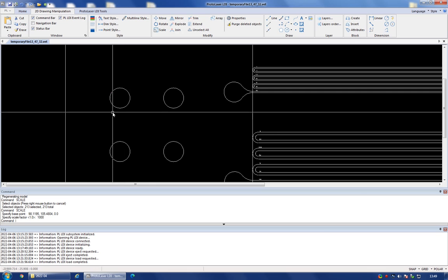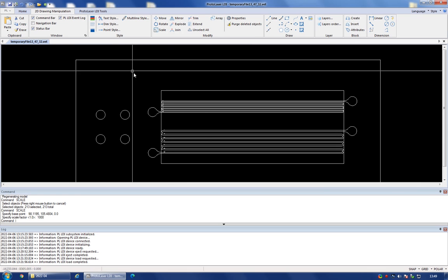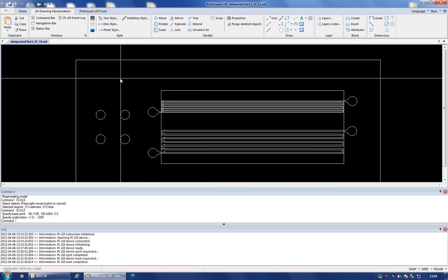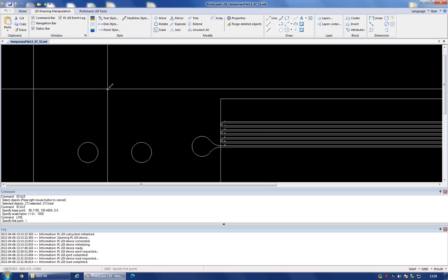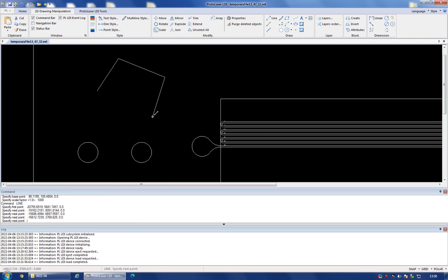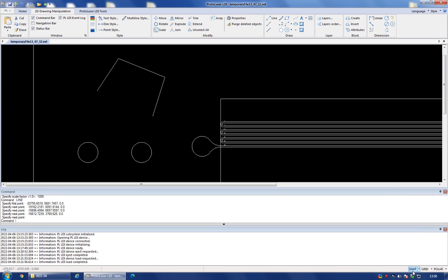So any enclosed shape really will work, but you have to be careful that it is enclosed. So for example, if I draw using the line tool, I draw just a random shape that looks like this. This is not an acceptable shape, so the software will not know what to do with a shape like this. On the other hand, we'll just turn on the snapping and the polar settings.